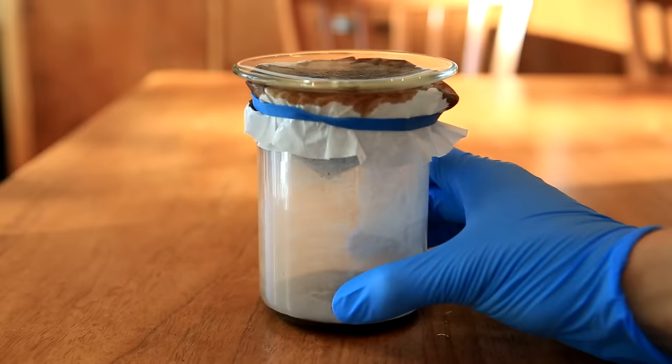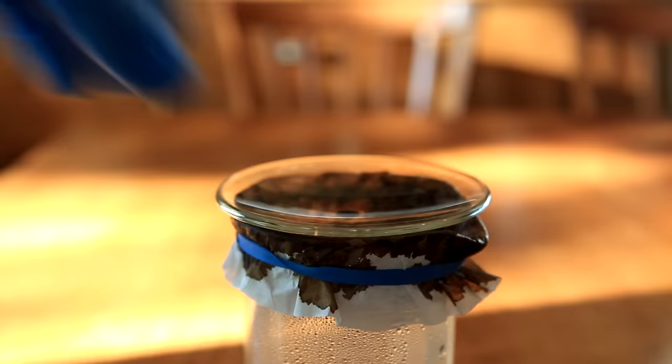The gravity filtration is pretty slow, but if you shake it around like you see here it actually speeds it up a little. Eventually almost everything is filtered through and we are left with some wet coffee grounds.